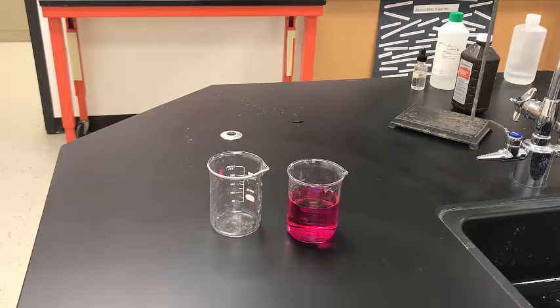So you're going to write your balanced equation for this reaction. Make sure you identify the type of reaction. Think about the fact they both had partners to start with. Both are going to have partners at the end too. Little double date swap there. Okay, after you've written your balanced equation, look at what your products are. And you should be able to see why it's completely safe for me to know that I can pour this down the drain.